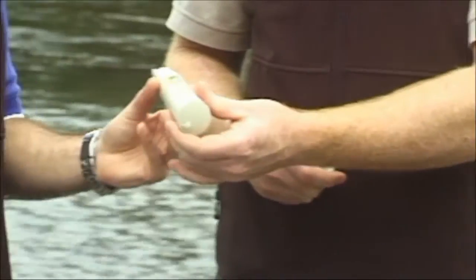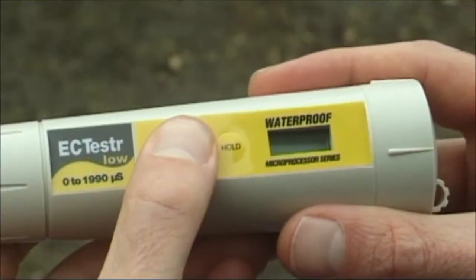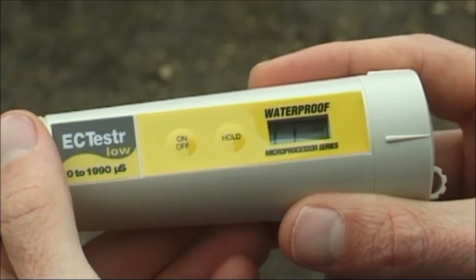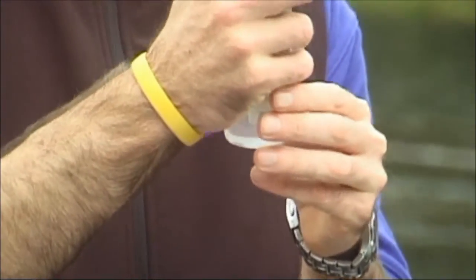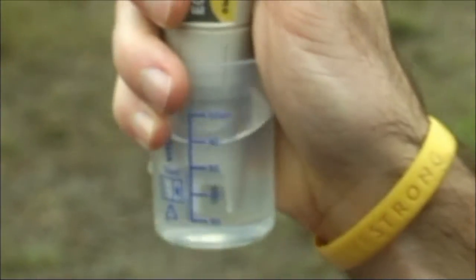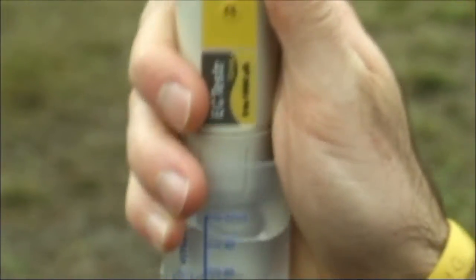Remove the cap from the meter and turn it on. Wait until a zero appears. Dip the meter into the container so that the probes are covered. Be careful not to put the meter deeper than the immersion line or to rest the probes on the base of the container.